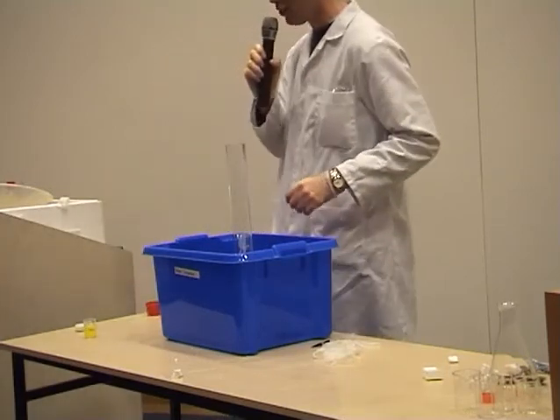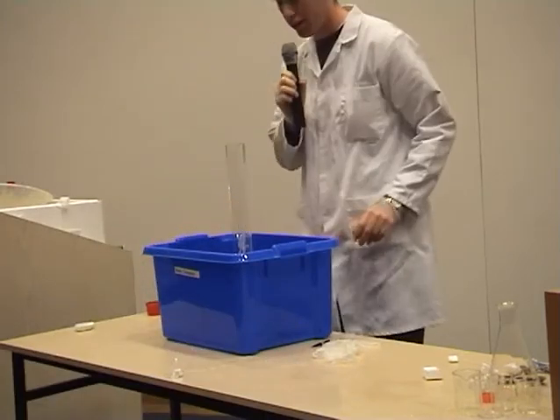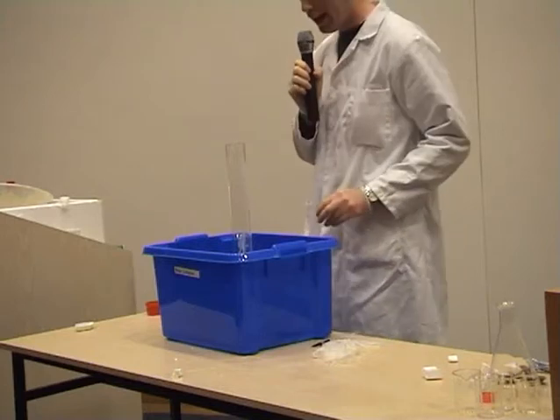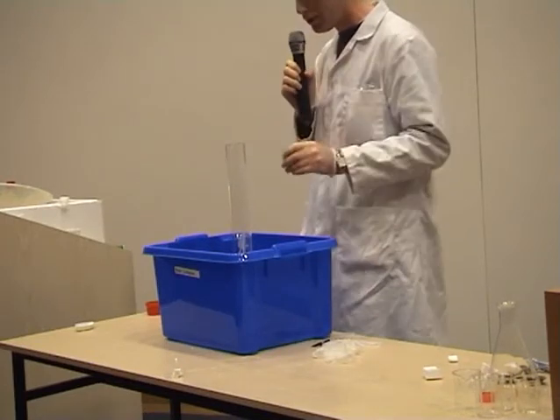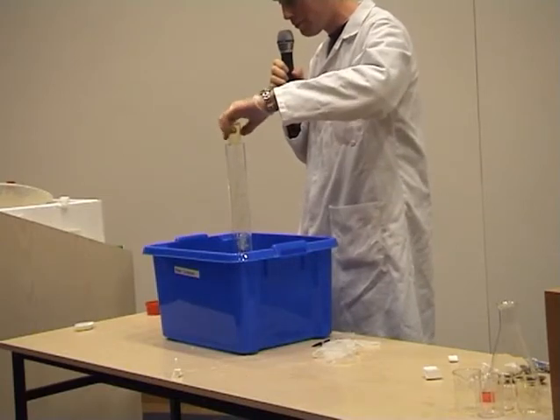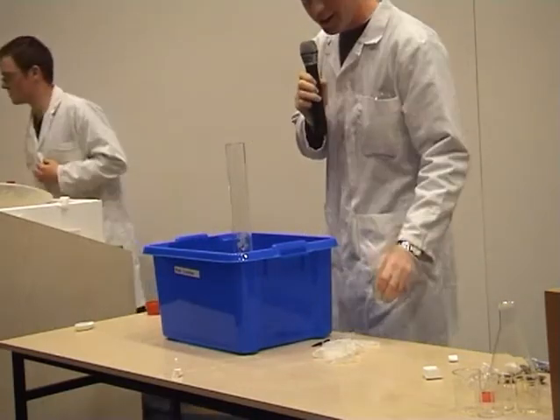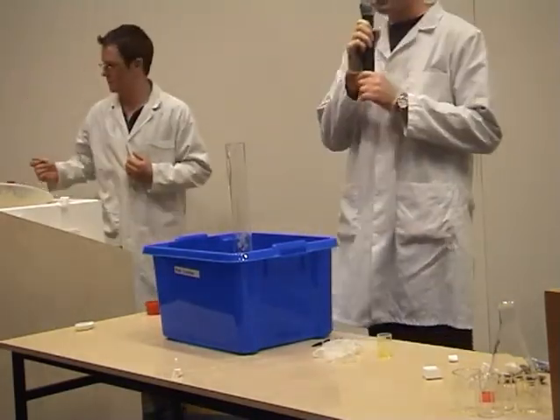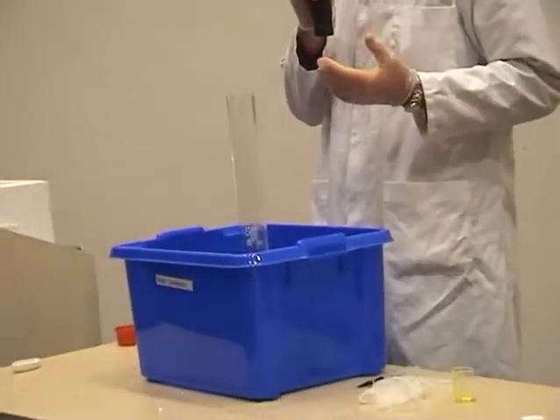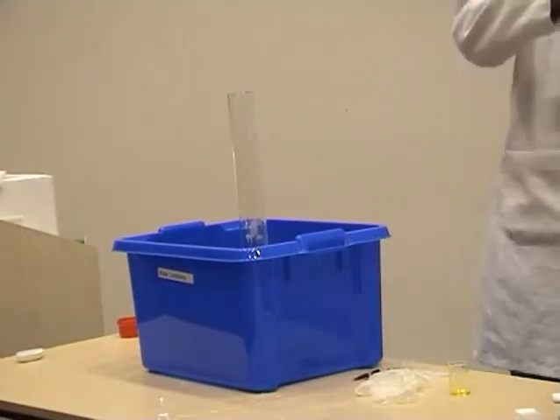As you can see, it takes a while. While the lads are adding hydrogen peroxide to the graduated cylinders, I'm also going to add something. And because we're going to make elephant toothpaste, we better make some colourful toothpaste. So I'm going to add some coloured dye, and my colleagues are going to add some dye as well.